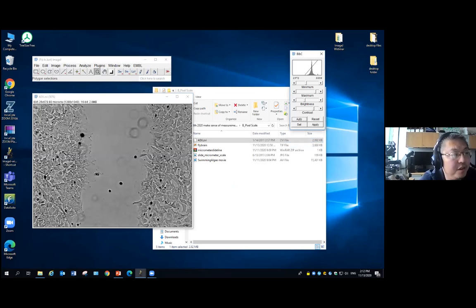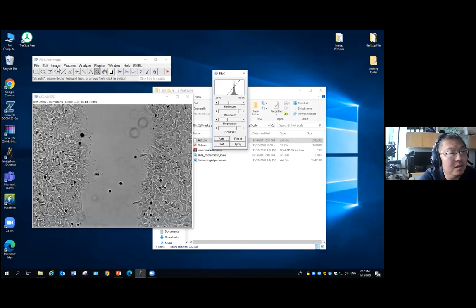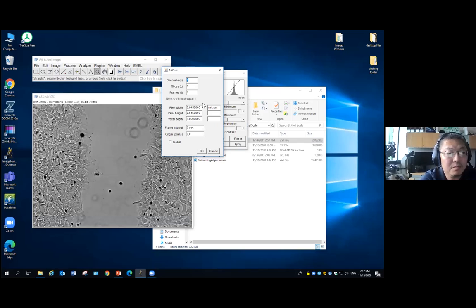Okay. So this is a bright field image of some cells in the dish. Then we'll ask, what is the pixel scale in the image? I will click image, properties, and that's it. For this image, the pixel scale is 1 pixel corresponding to 0.645 micron. That's actually saved by the acquisition software on your equipment. Ready? That software will calculate it based on the objective and the camera settings you use. Ready? And generally, ImageJ can read this data very well, but I always suggest you double check at the beginning. Check this information on your acquisition software on the equipment, then open the image in ImageJ and check it again. Make sure they match.